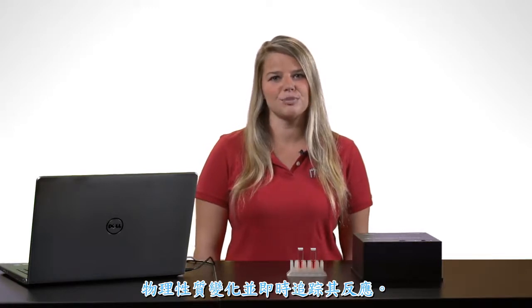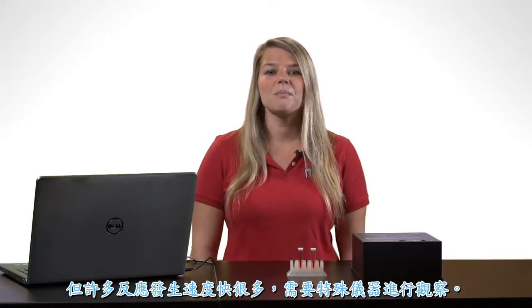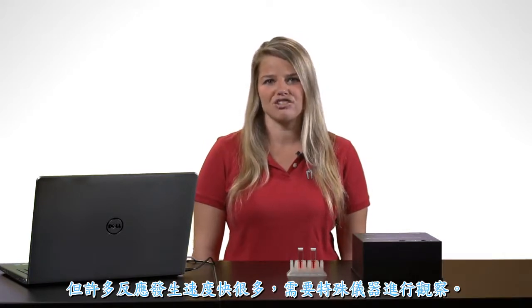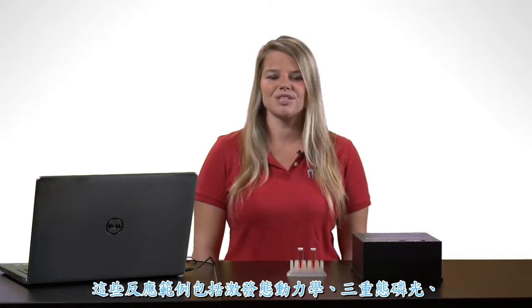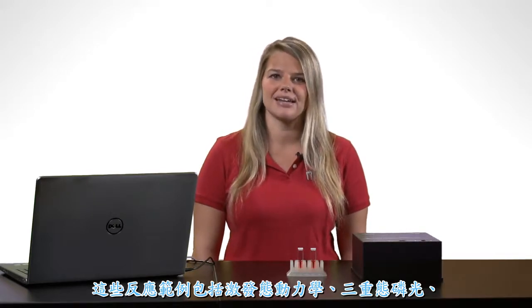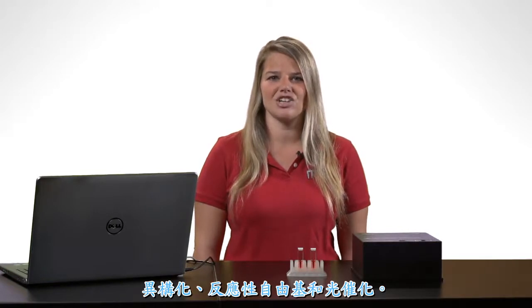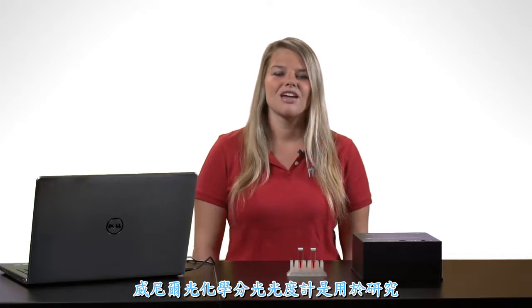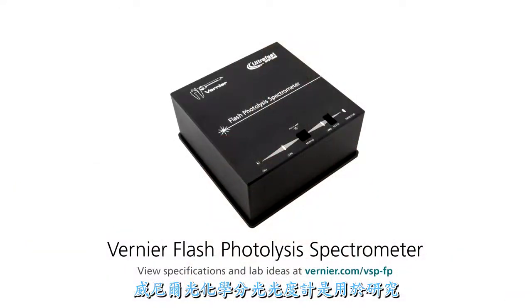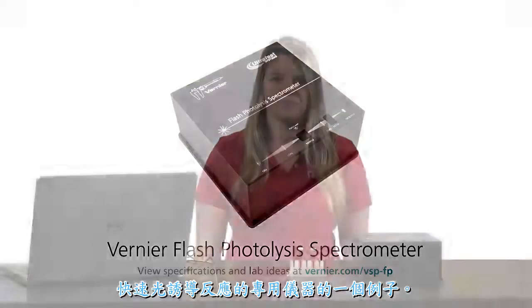This process is suitable for reactions which take place on the scale of minutes or longer, but many reactions take place much faster than this and need special instrumentation to examine. Examples of these reactions include excited state dynamics, triplet state phosphorescence, isomerization, reactive free radicals, and photocatalysis. The Vernier flash photolysis spectrometer is an example of a specialized instrument used for studying these fast, light-induced reactions.